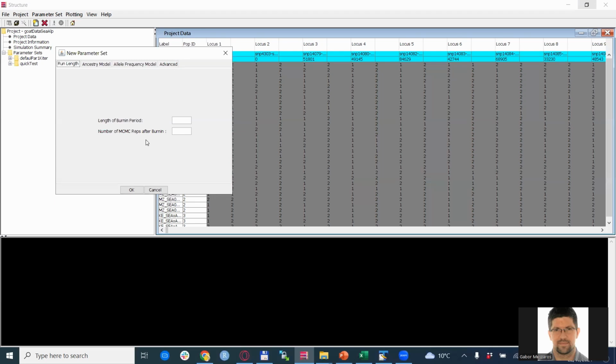Now, there is a bit of a downside, I would say, of the Structure software: it takes quite long to finish. So if you want to do a proper analysis, you need to set a quite high number of iterations, in the thousands. If you want to do this test, then you need several replicates. So expect a longer runtime.